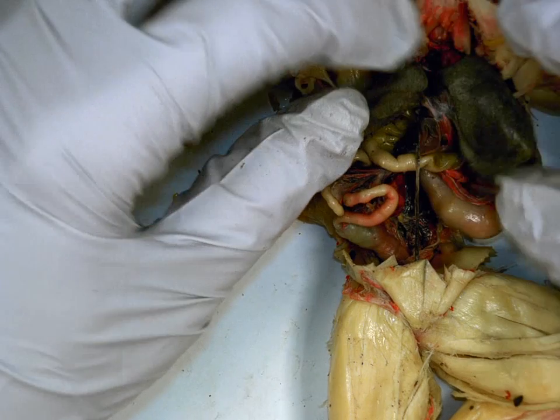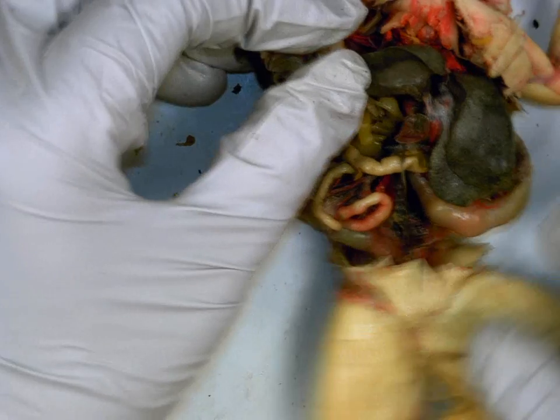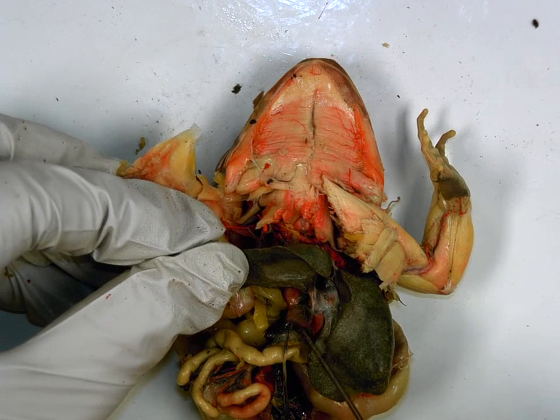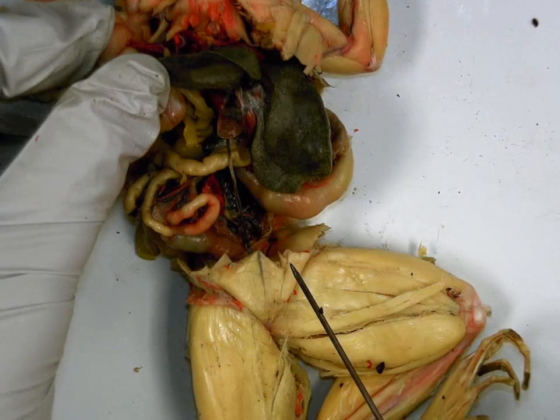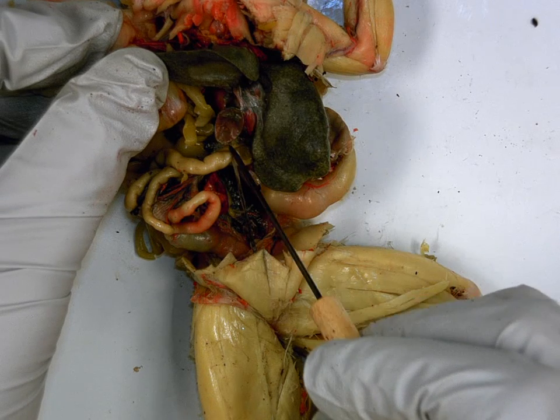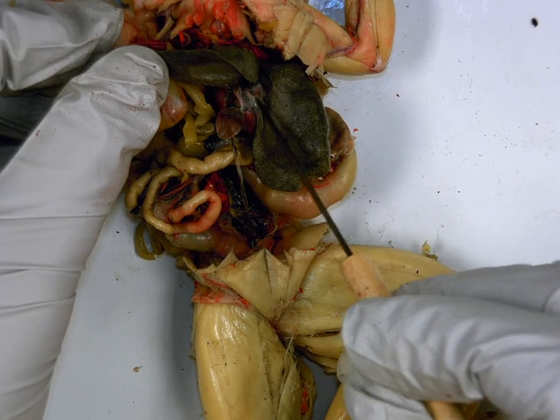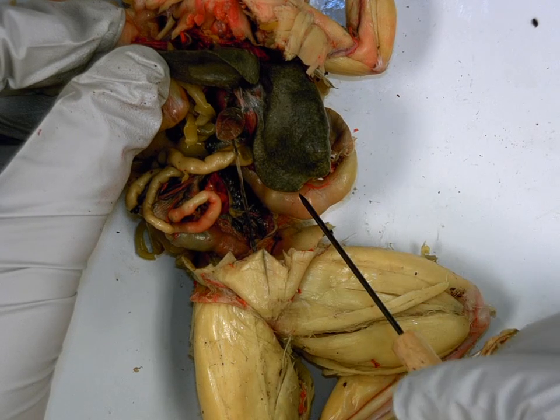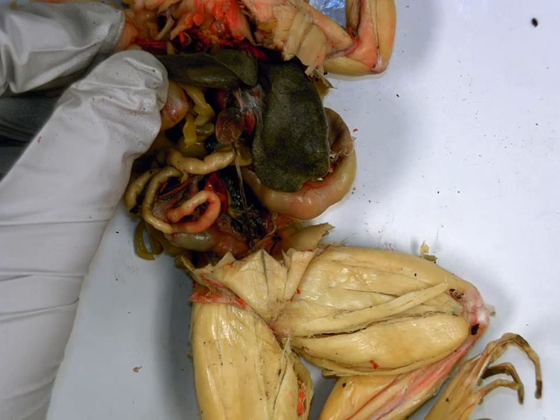Then we have this, and a student in second period said this perfectly. This area in between the 3 lobes of the liver looks like a dehydrated grape. Looks like a tiny little grape pouch, which is the gallbladder. What's the function of this gallbladder? Stores bile. So again, it looks like a dehydrated grape or a raisin in between the 3 lobes of your liver. Okay.